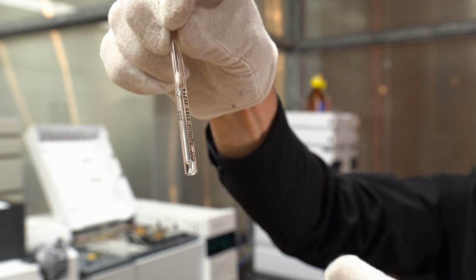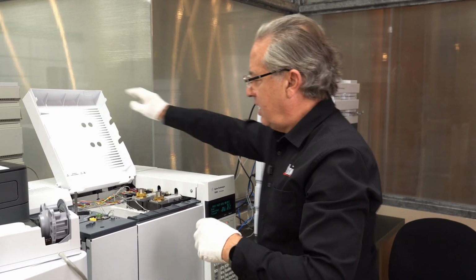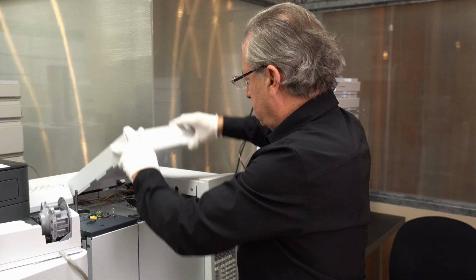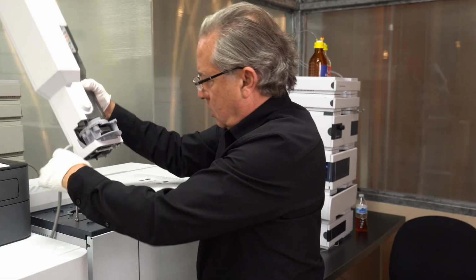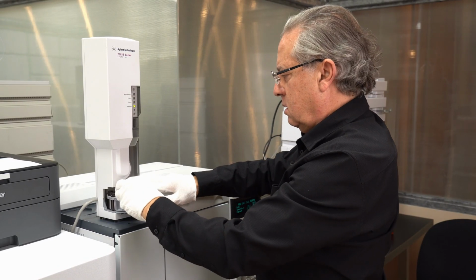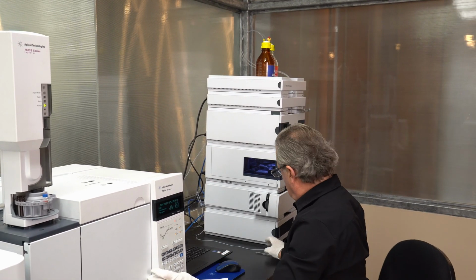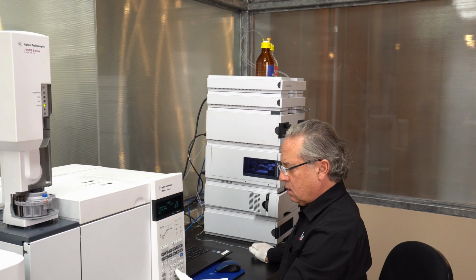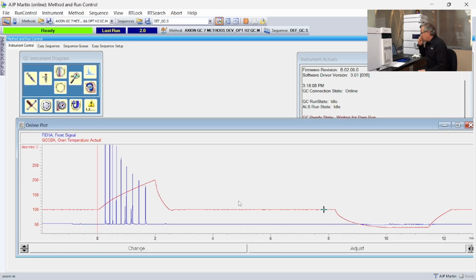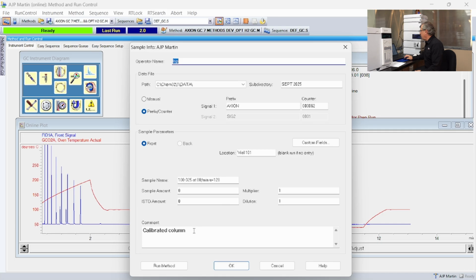So now let's go back to the GC and see if this made any difference. Put our autosampler back on. Put my sample back in. We'll come back over here. And I'm going to turn the oven back up to 100 degrees. So the GC is just now coming up to temperature. I'm going to go to run control, sample info, and this time I'm going to say new column, or new liner.